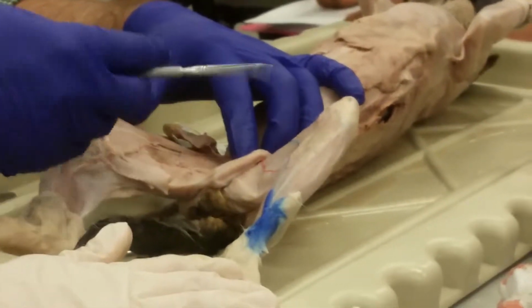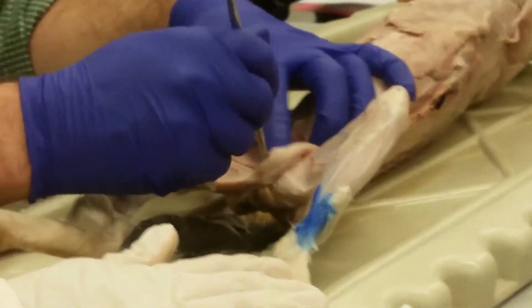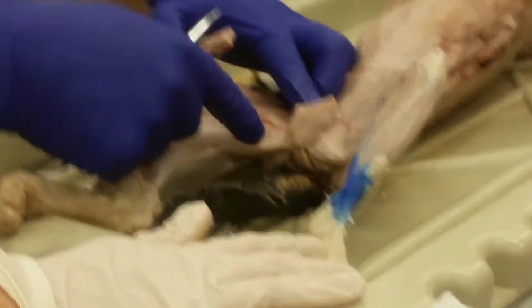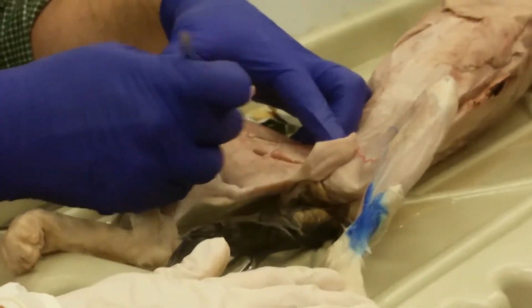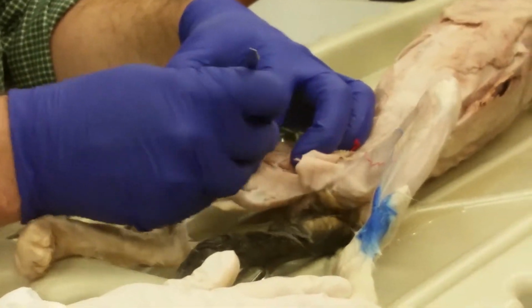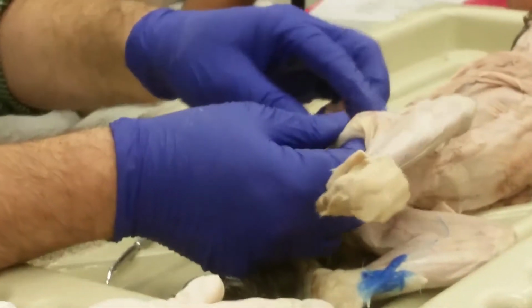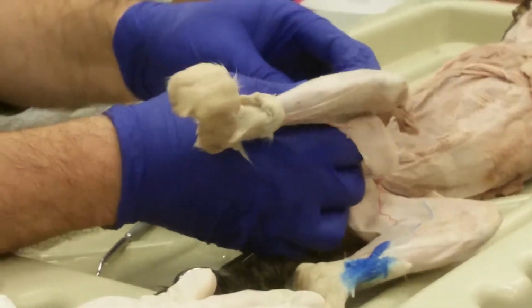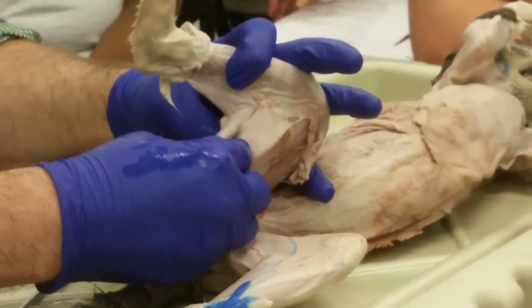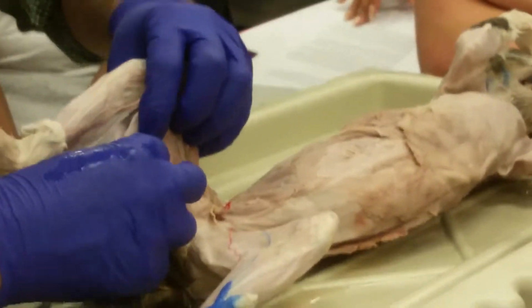All right? Now this muscle across this little gap here is actually one of the hamstrings. This is the semimembranosus, and just in front of it is this other hamstring muscle, semitendinosus. Let me get my finger in there and try to separate that out a little better. Man, this is a tough man. It's a tough kitty.